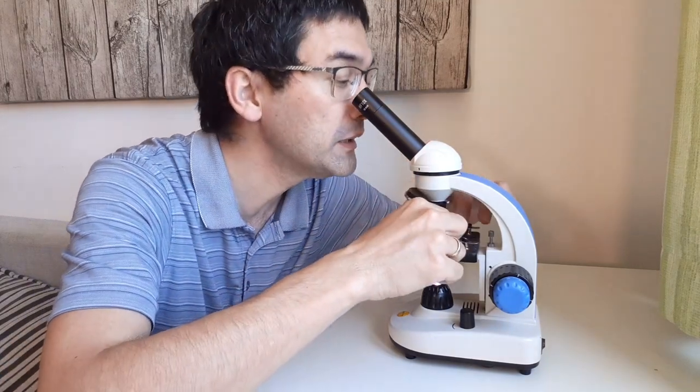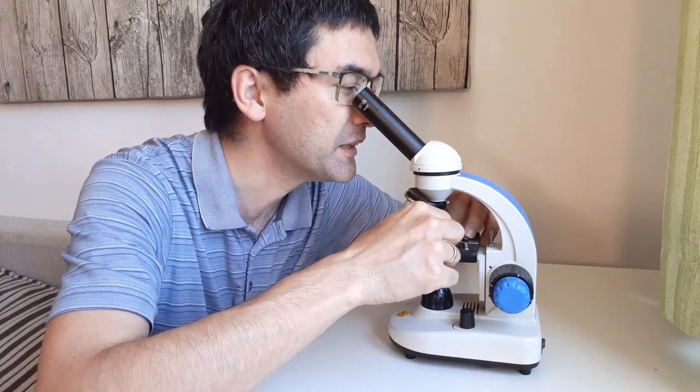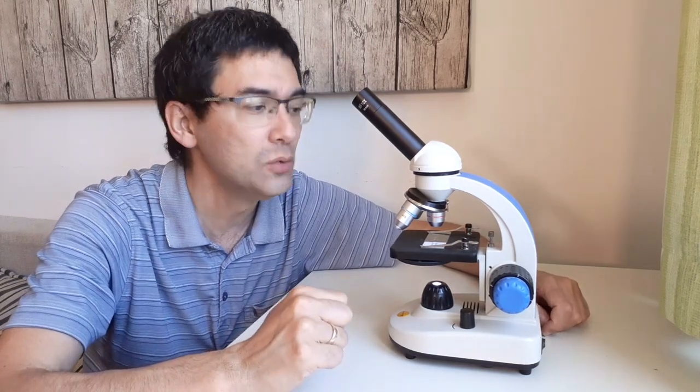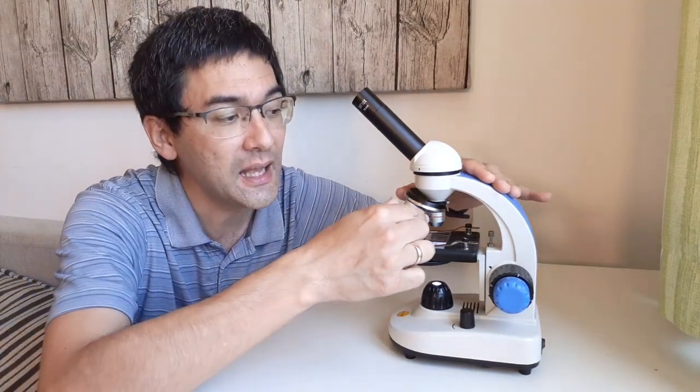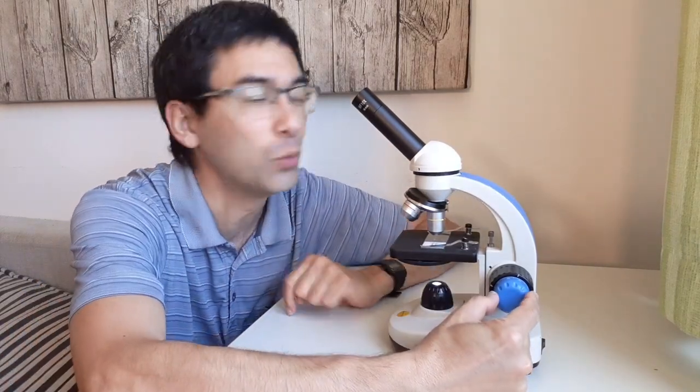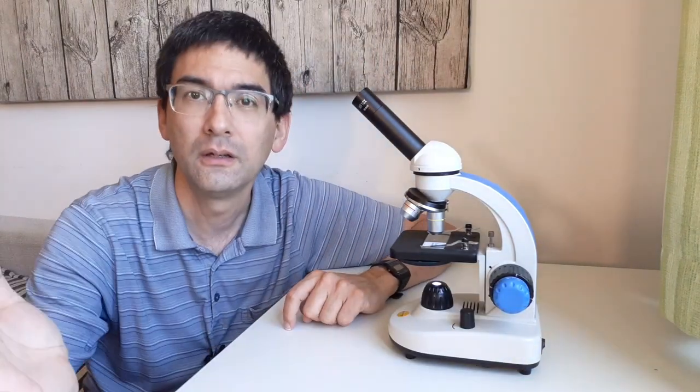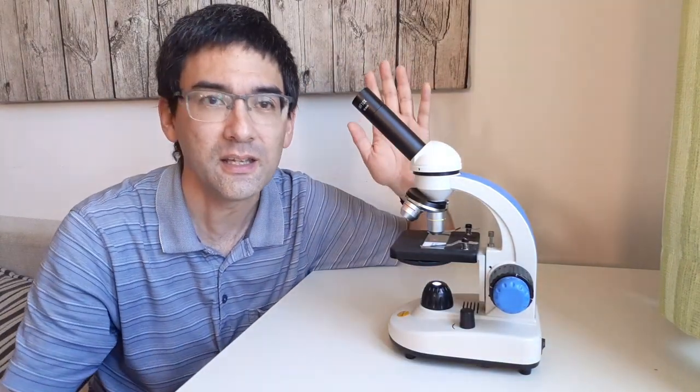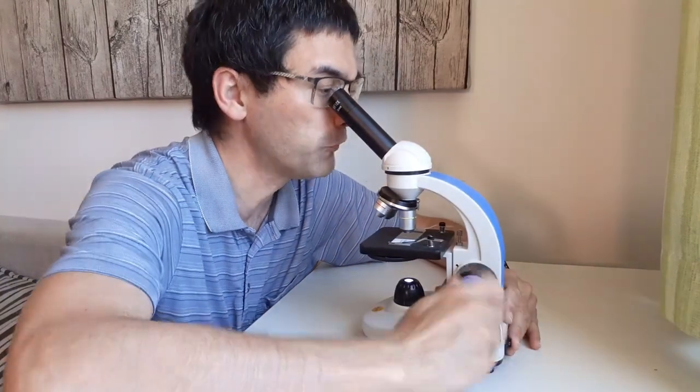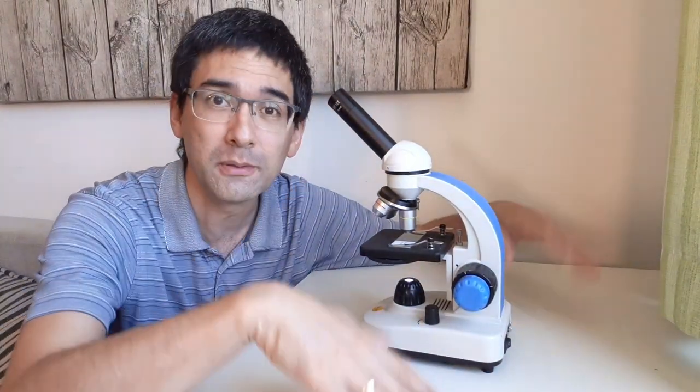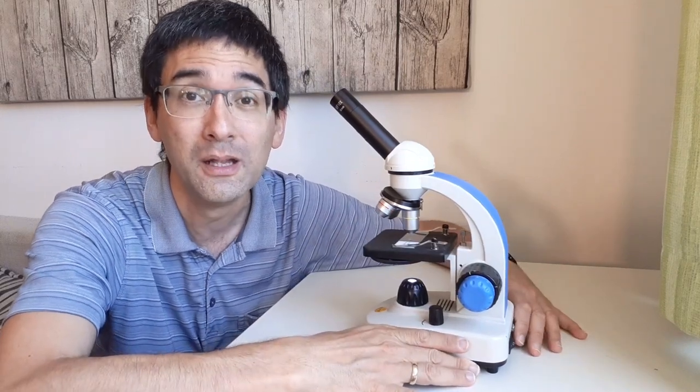And then you look through it and then you turn it down. You lower the stage until you see a sharp and a clear image. It's that simple. I'm finished. How long did it take me? Five seconds? Not even. And then what you do next is you look through it and then you re-center the slide.